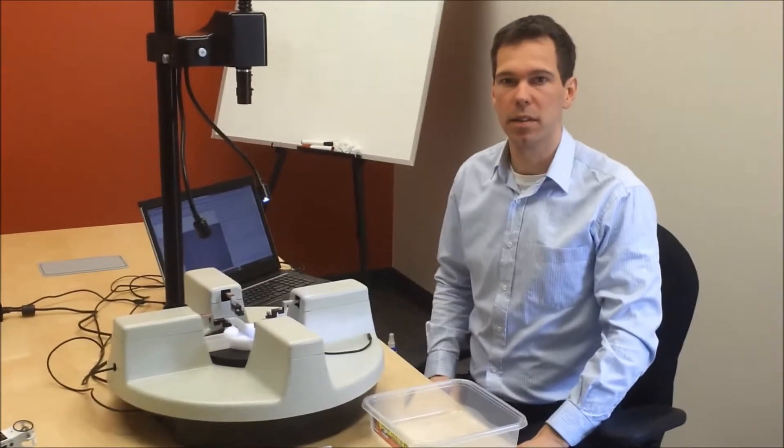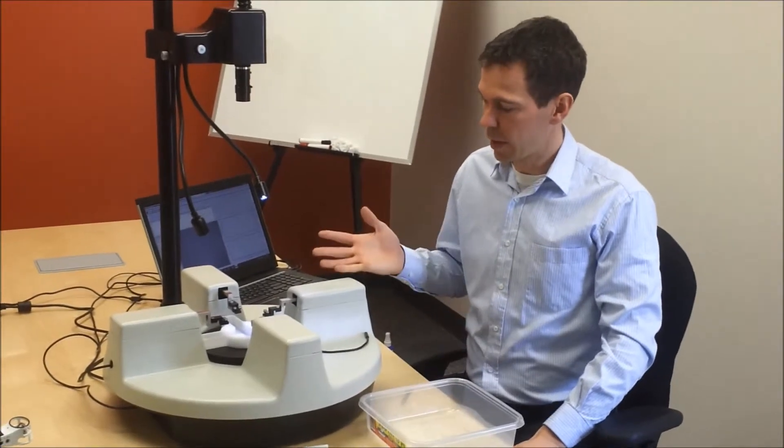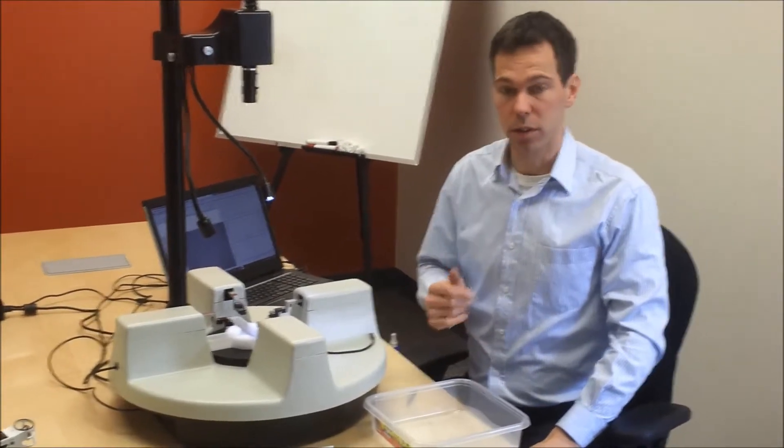Hi, I'm Caleb Horst with CellScale Biomaterials. Welcome here to this demonstration of using the Biotester Biaxial Test Device with sutures.